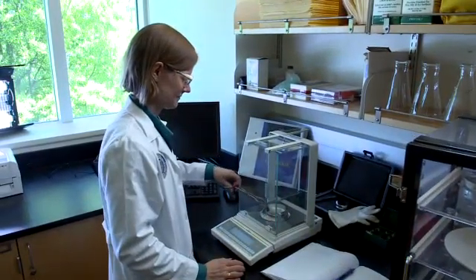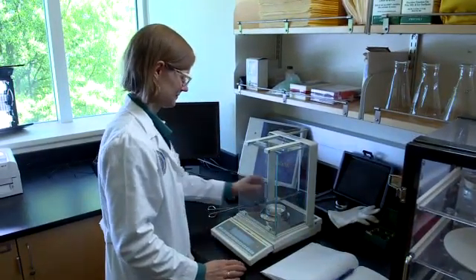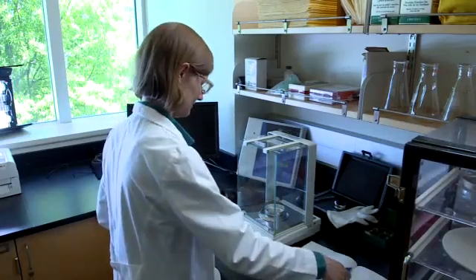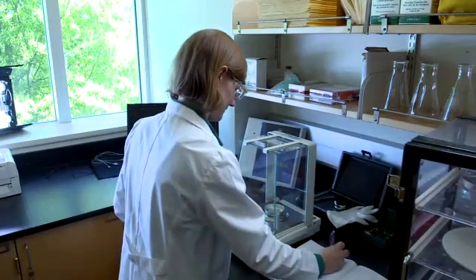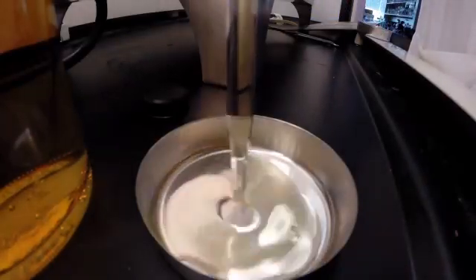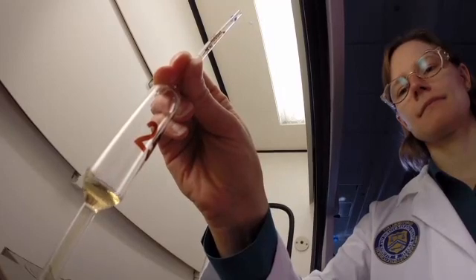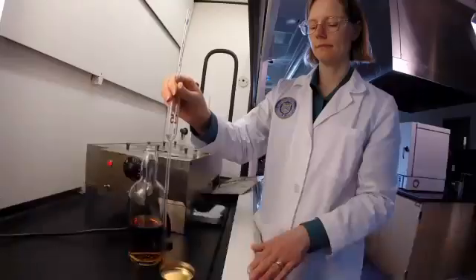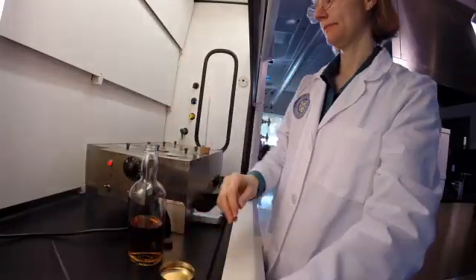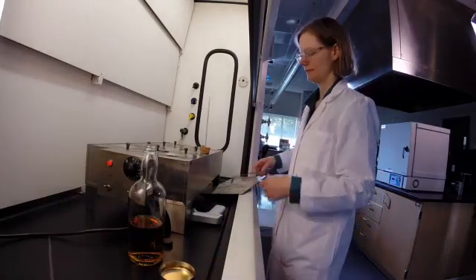Weigh a dried, empty aluminum dish on an analytical balance. Next, add 25 milliliters of sample spirits to the weighed dish. Place on a steam bath and evaporate to dryness.